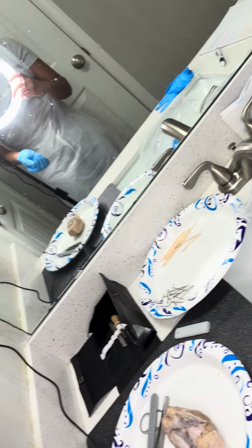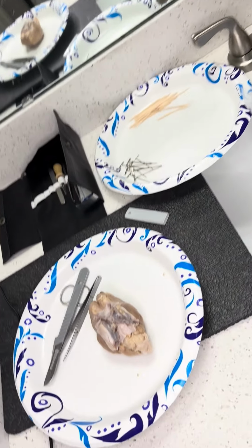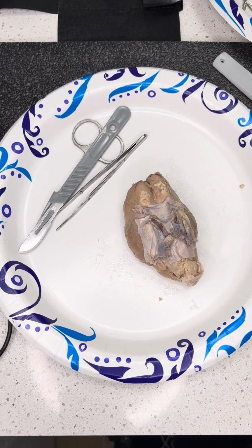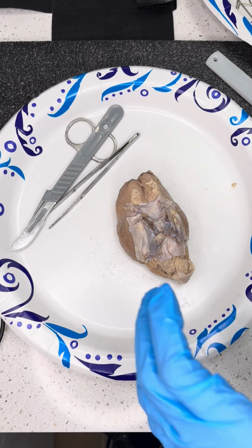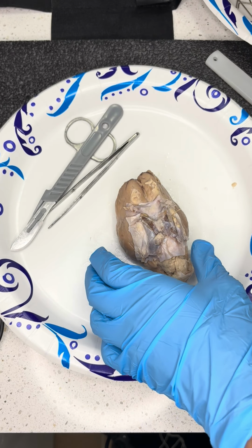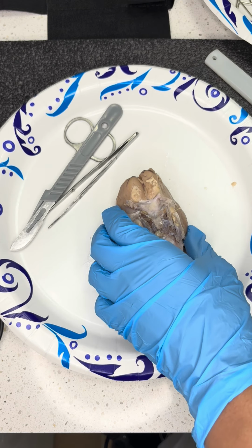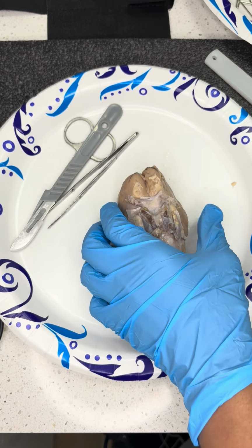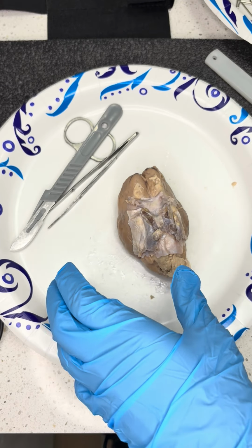As for me, I am in full PPE. I will be putting my gloves on in just a moment. One moment while I get everything set back up here. Okay, so, let's see. So I will be touching this paper and pen. They will be getting tossed out at the end of this. I just won't be changing my gloves for time. I'm already a minute in with just the introduction. So anyways, let's get started.